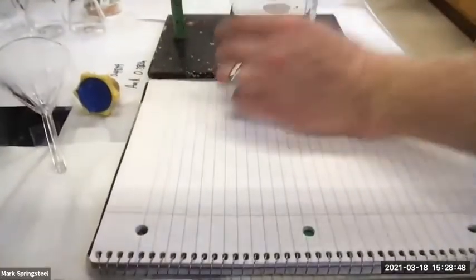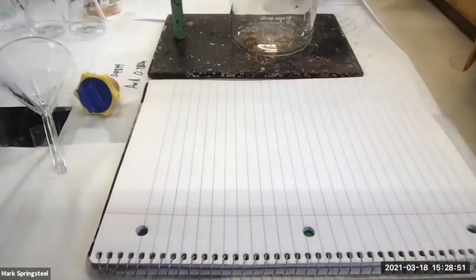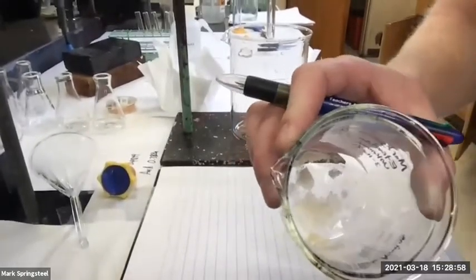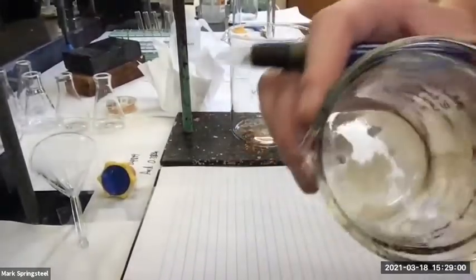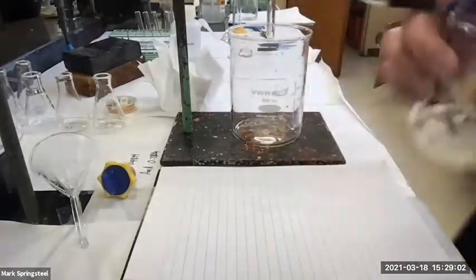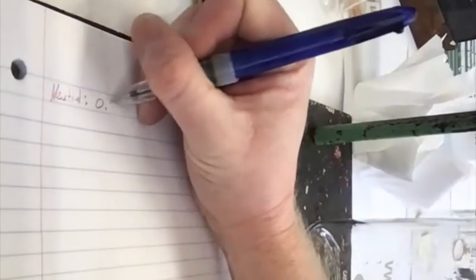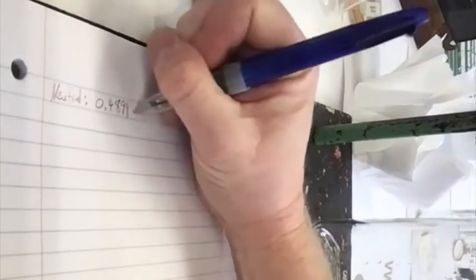This is what I weighed out earlier. Actually, last time I was here, was that Tuesday? On Tuesday, I weighed out some solids to do our extractions of. So you can see there's different colors to that. You can tell that it's not all the same thing. Okay, what I have in there is a neutral compound. And when I say neutral compound, I mean something that's going to remain neutral. It's not going to get a charge, not a negative charge, not a positive charge. And I weighed out 0.4899 grams of that. I weighed it out on the scale last time.